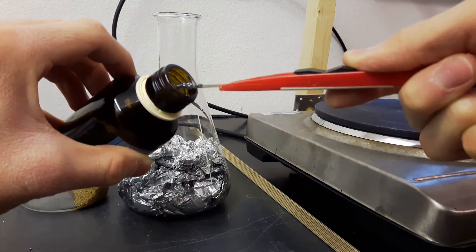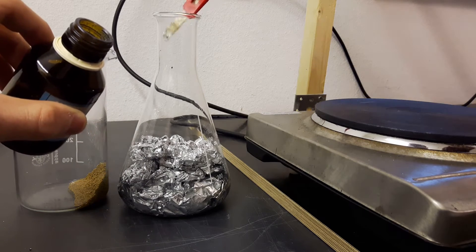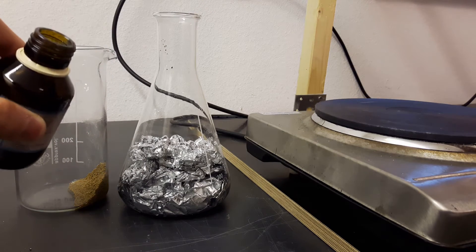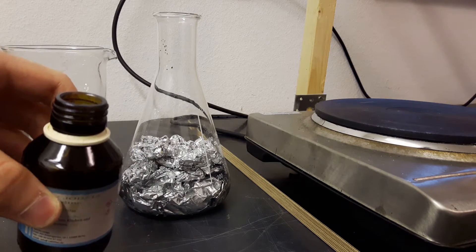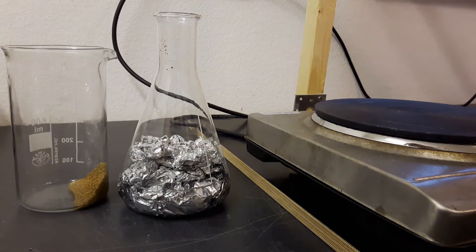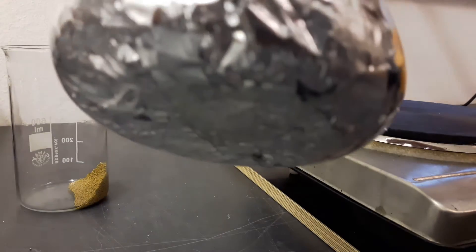And as the video title already says it was a fail. So not the reaction was a fail it worked. I produced quite a lot of aluminum isopropoxide but I did not manage to distill it properly. And I had some problems with my distilling apparatus.